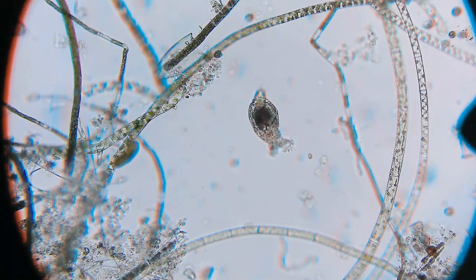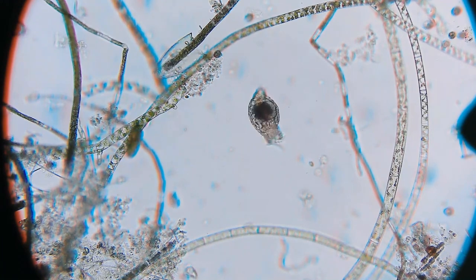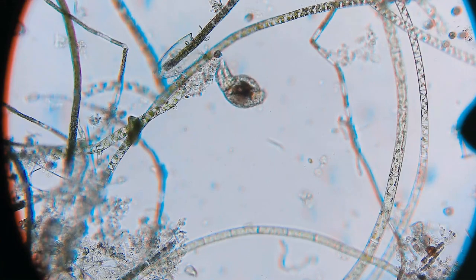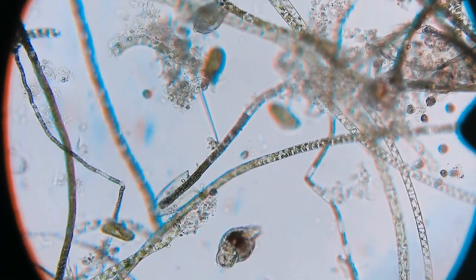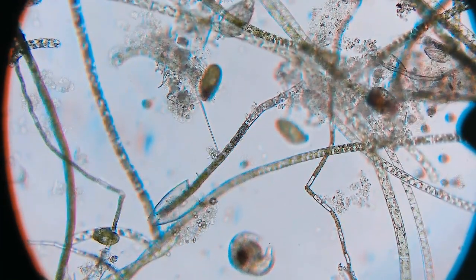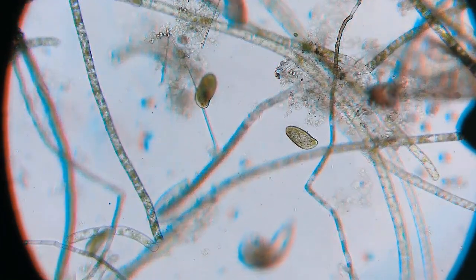I'm going to show you how to make filters for viewing samples in 3D through a single objective on a binocular or trinocular microscope. Just a note that this was originally inspired by Diet Tom's presentation of Shinya Vision, link in the notes, but I think I've made a couple of improvements.